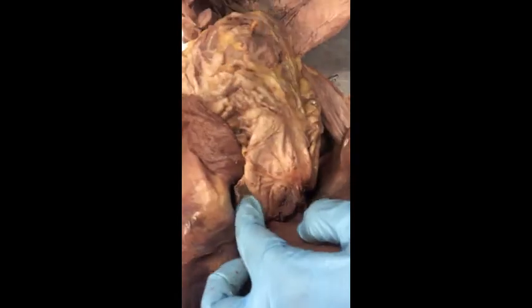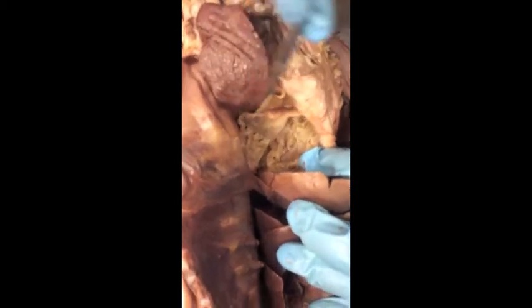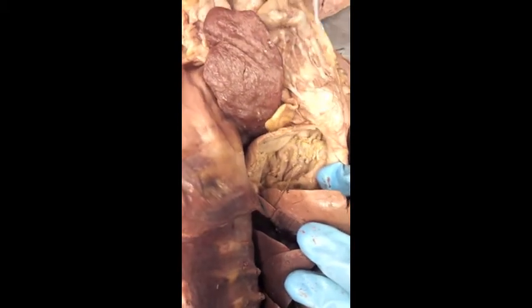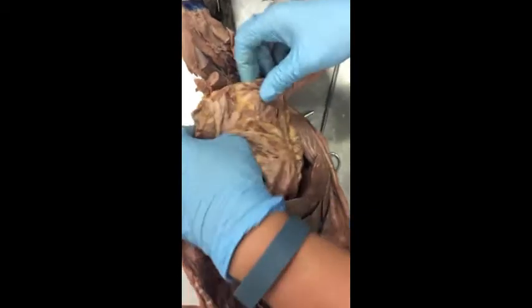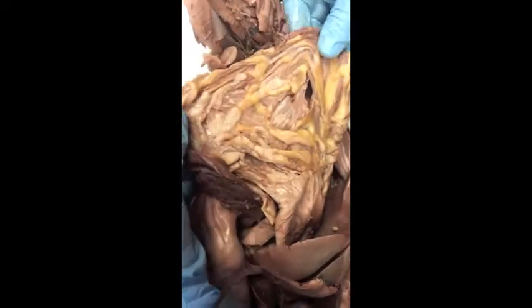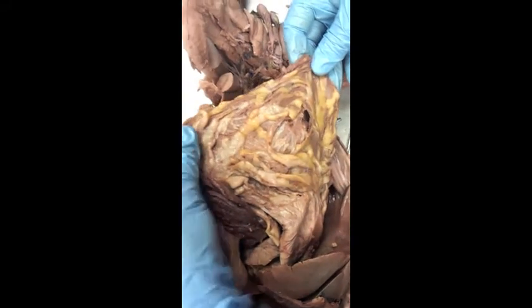Now the stomach has been cut open so that you can see rugae inside of it. They're not the greatest rugae, but you can see the little wrinklies in there amidst all the food chunkies that are the little rugae, the gastric folds. Hanging off of the greater curvature of the stomach is the little apron of fat that is the greater omentum.